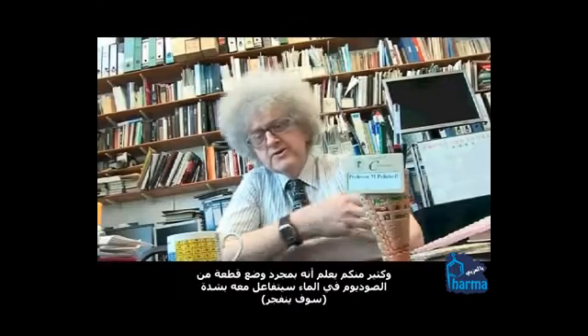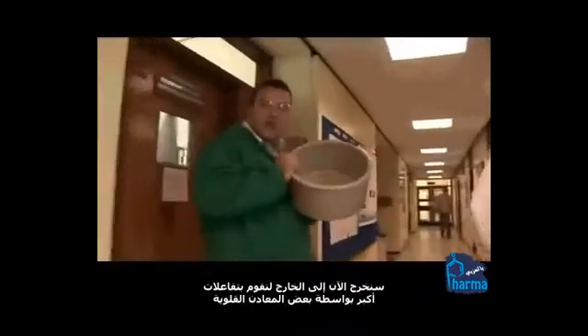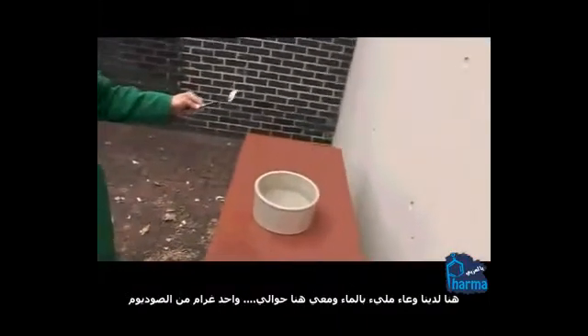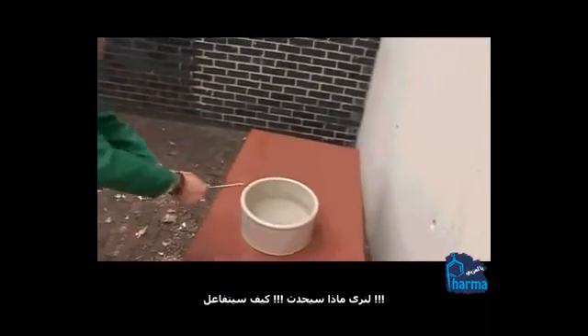Many of you will know that if you drop sodium into water it reacts almost explosively. So we're going to go outside now to do some bigger reactions with some of the alkali metals. This is a dog bowl which is stoneware — it's very hard, not likely to break unless I drop it on my toes. This is sodium, the metal that we cut a minute ago, and there's quite a substantial amount. We're going to pop it into the water and see what we can do with the reaction. Here we have a bowl full of water and maybe a gram of sodium.